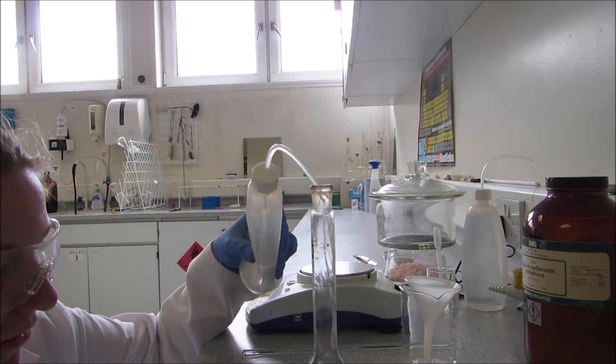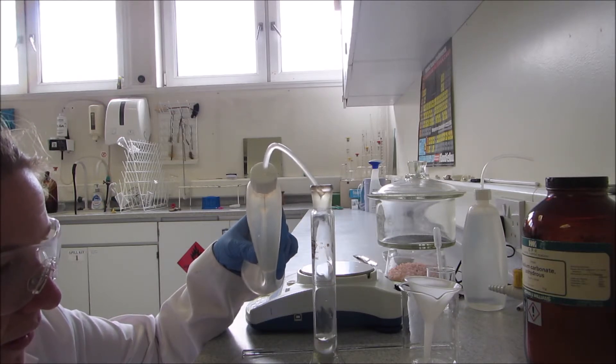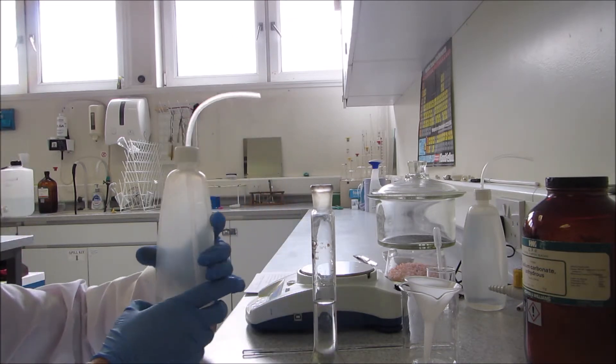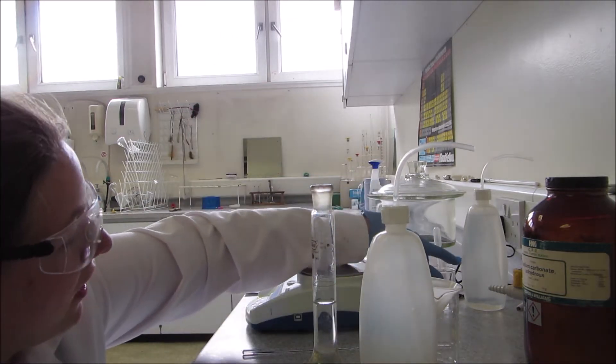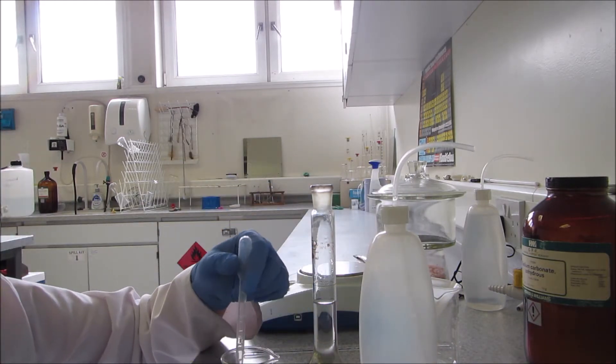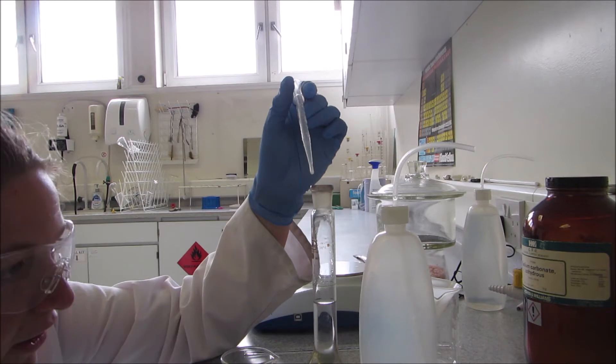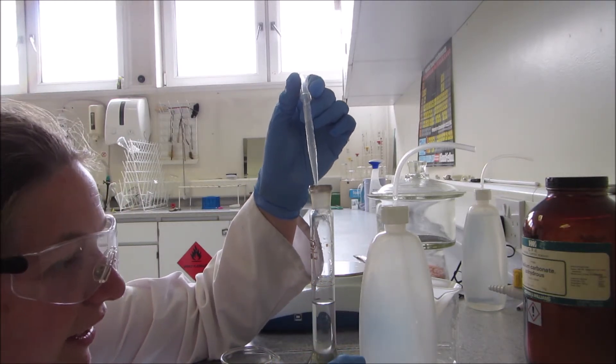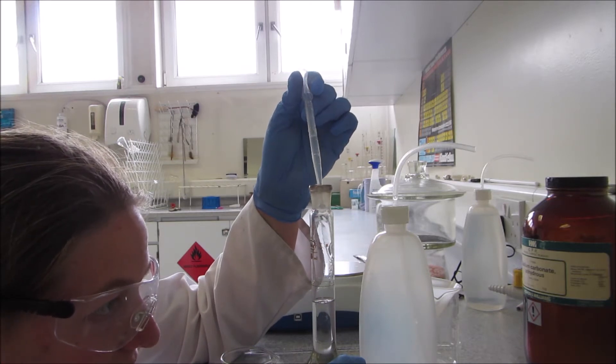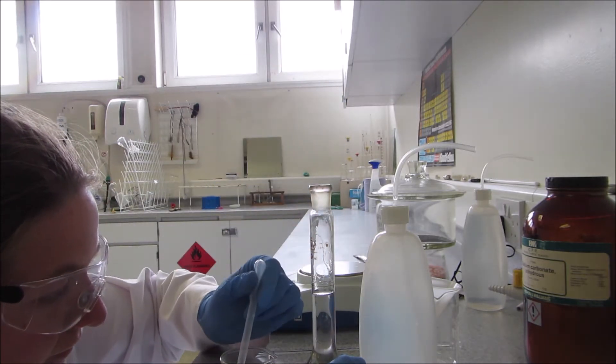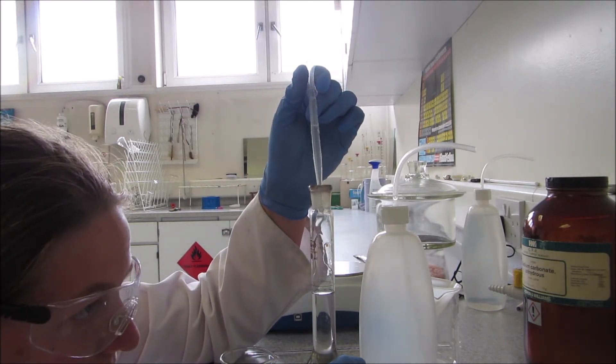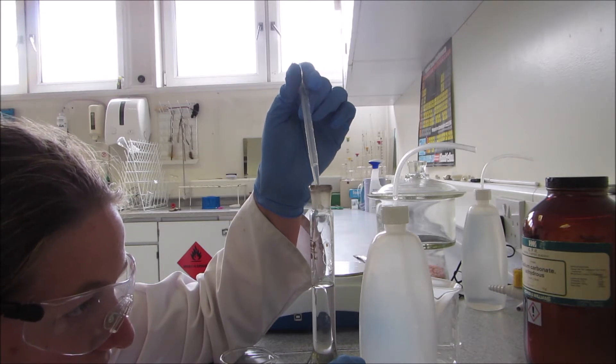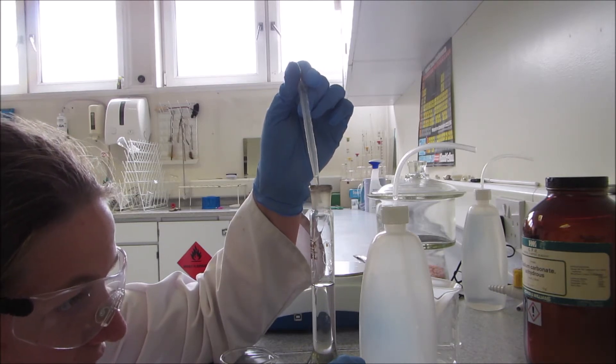I'm gonna start filling quite fast, and once I get closer I find control is easier with a small plastic pipette than with the wash bottles. So I've got it at eye level where I can see one side of this line touches the other. I'm just gonna slowly add. The aim is to get it so that the bottom end of the U-shaped meniscus just touches the top of this line.